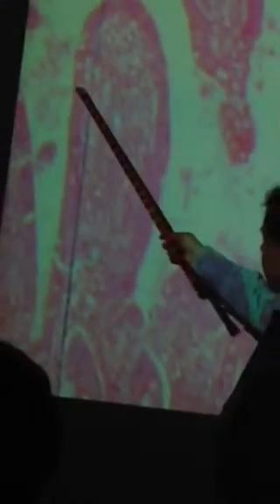Well, you got goblet cells scattered amongst there, right? You got finger-like projections coming up with a simple columnar epithelium with a connective tissue core. These are villi. Okay? These are from the intestines. These are villi. So there's a mucus-secreting goblet cell. All these little clear areas, those are mucus-secreting goblet cells, okay?